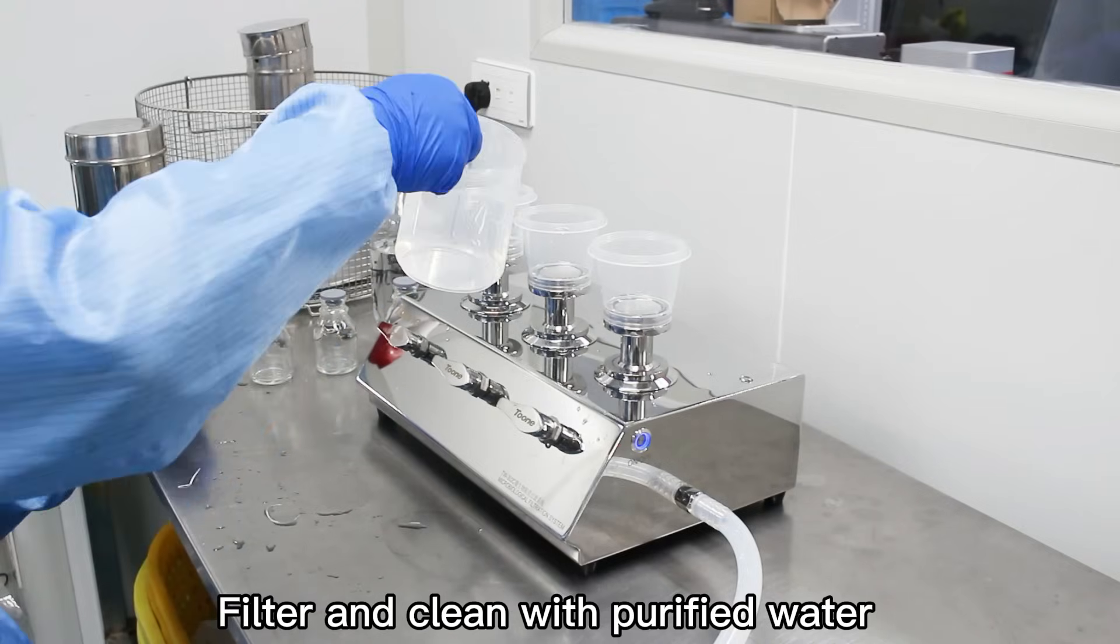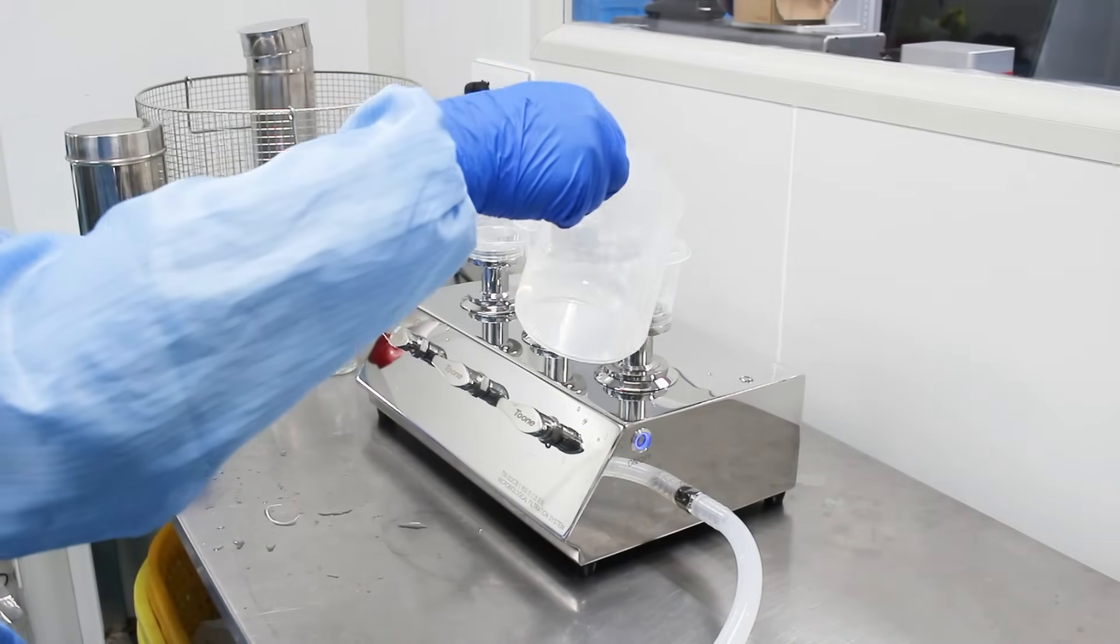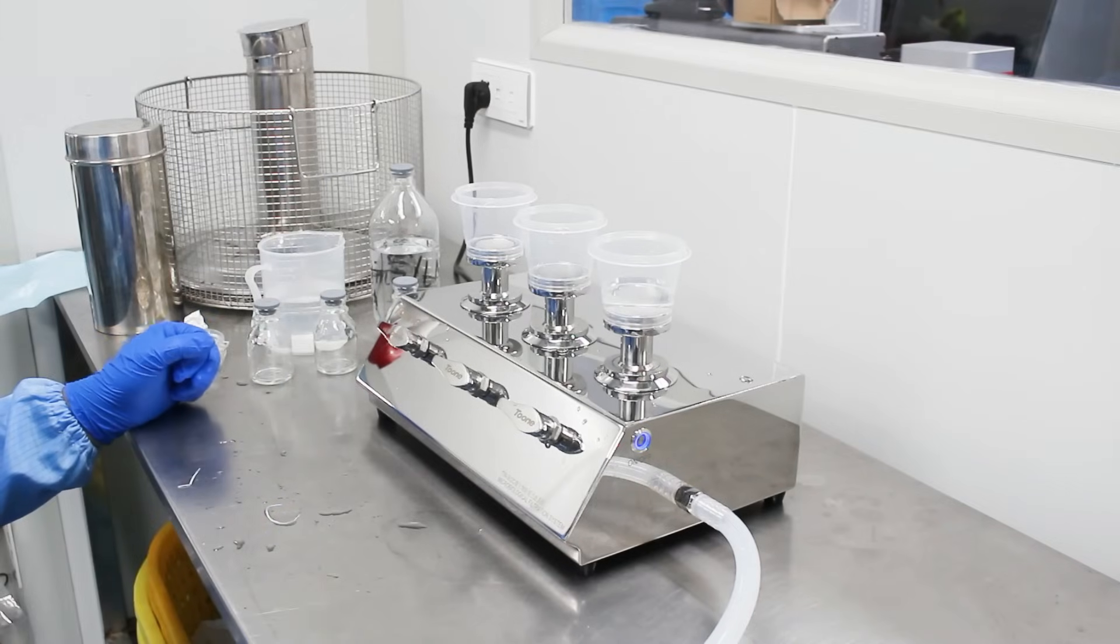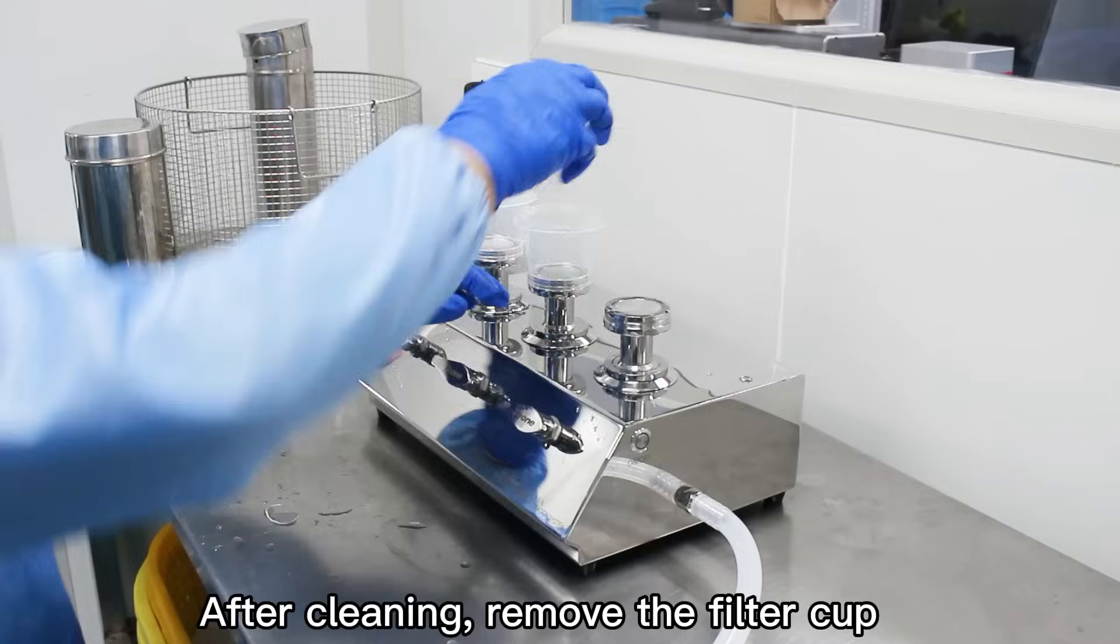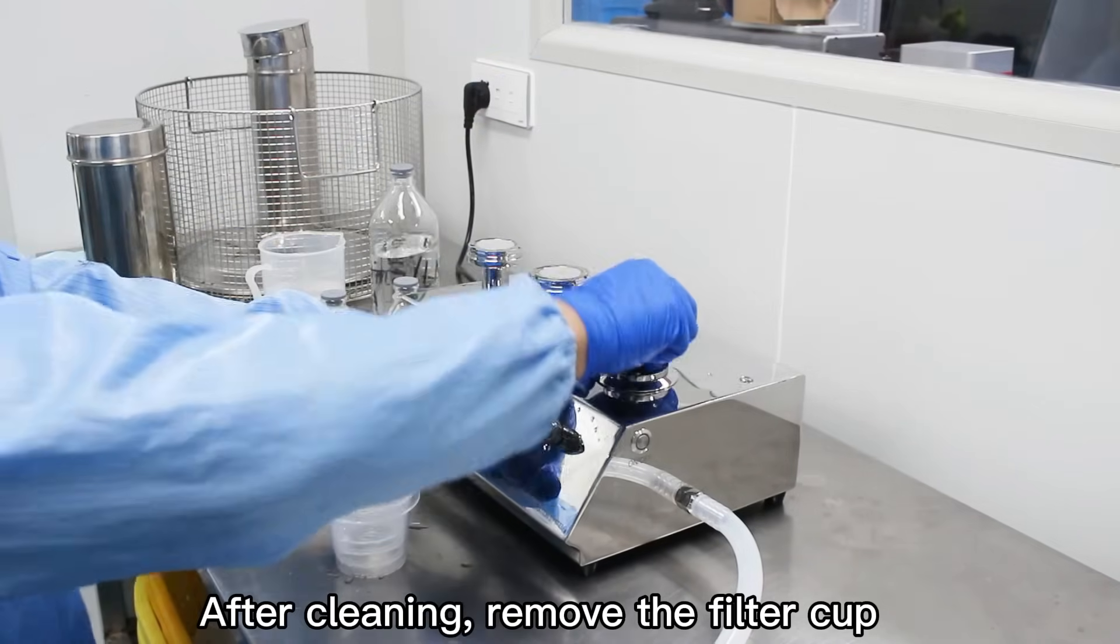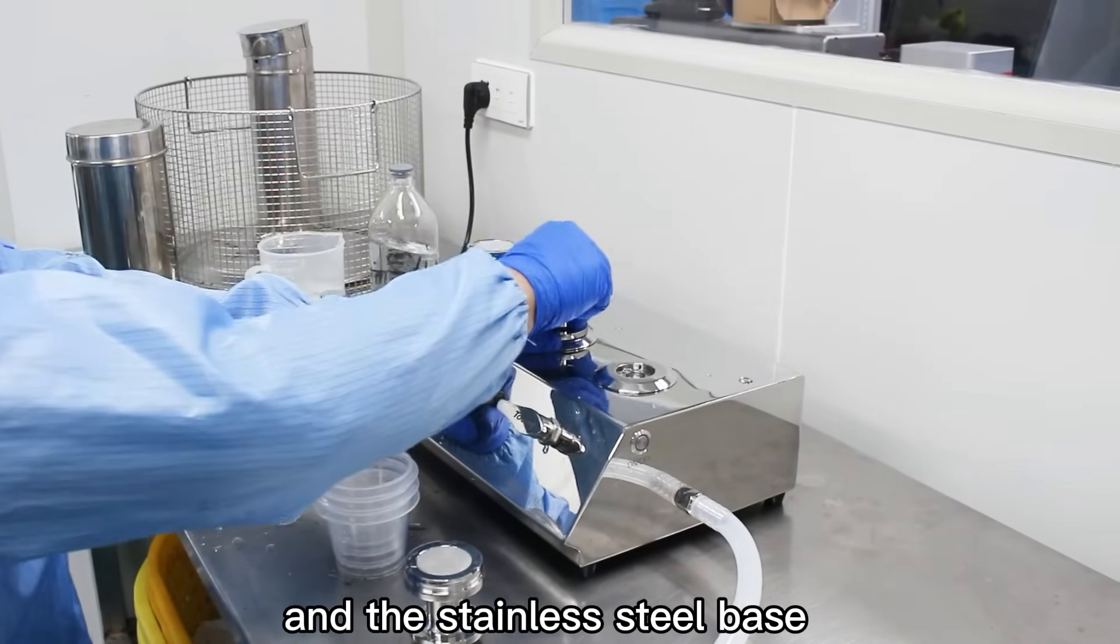Filter and clean with purified water. After cleaning, remove the filter cup and the stainless steel base.